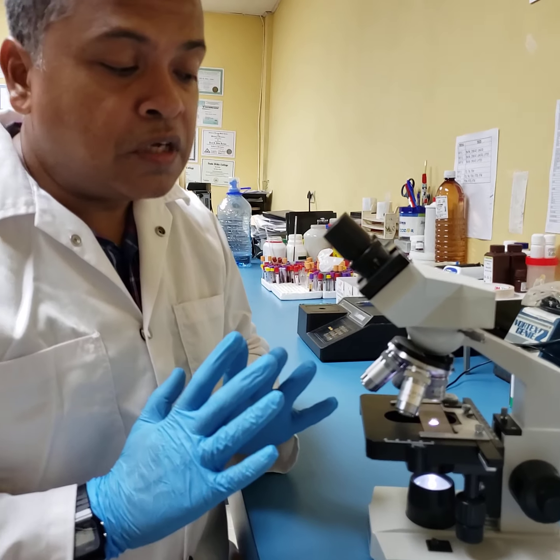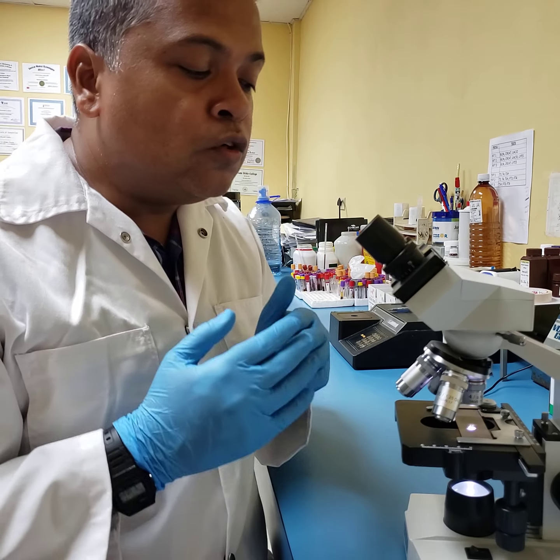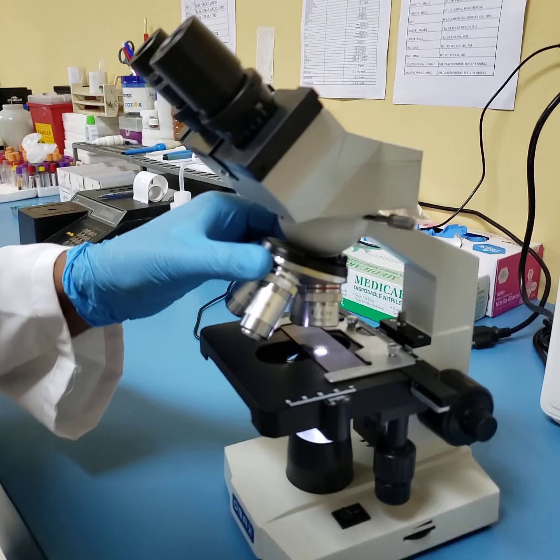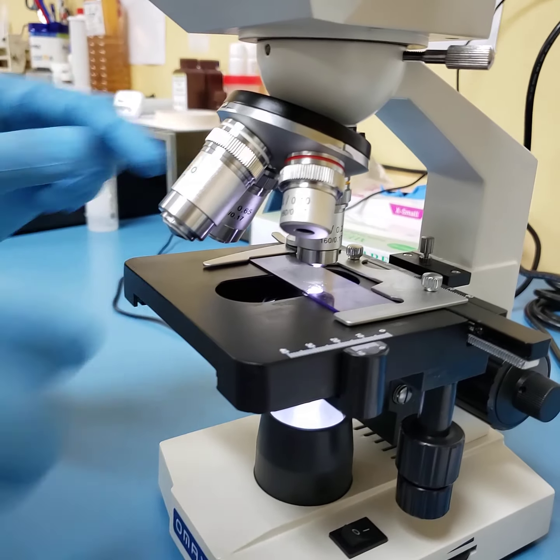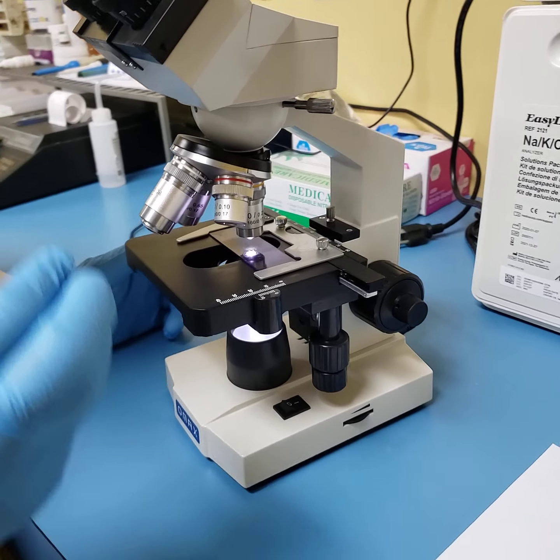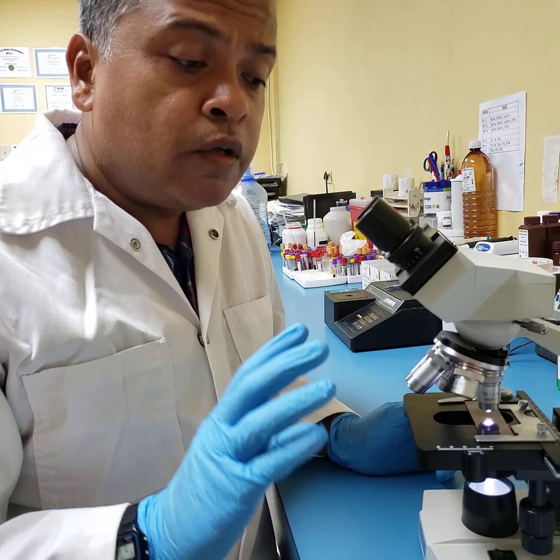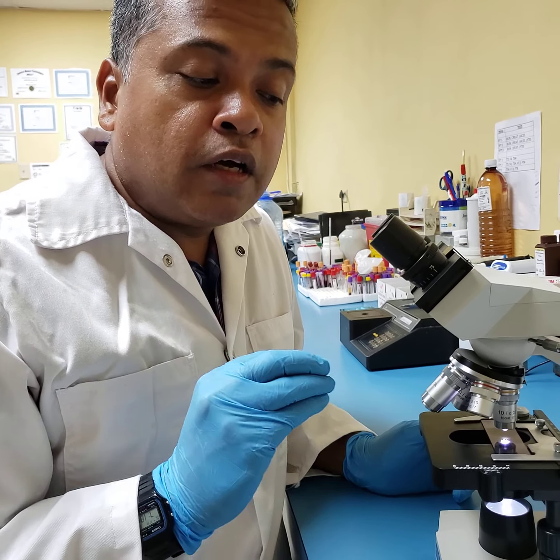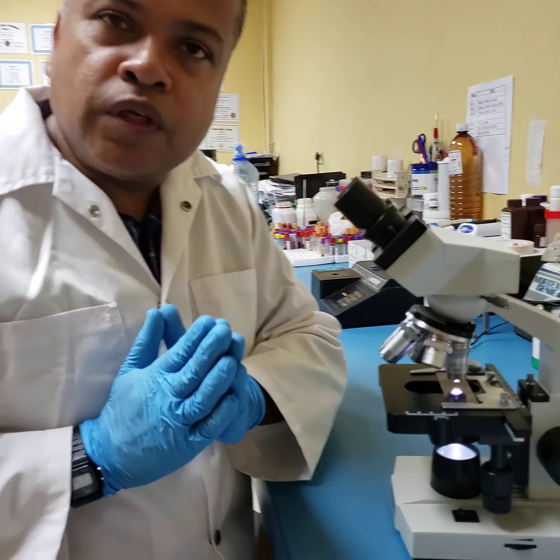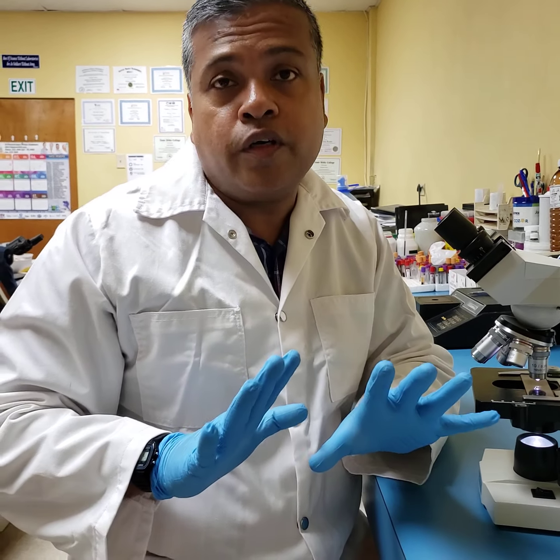But now, students, we want to magnify this image, and in doing that, all we have to do is turn our nose piece or flick our nose piece from 4 to 10. You actually would hear or feel a little click. What we have done here now is moved from 4 magnification to 10. You will recall just now, I adjusted the coarse adjustment knob by turning it towards me. Now, students, very important, the coarse adjustment knob is no longer used. It is no longer used.